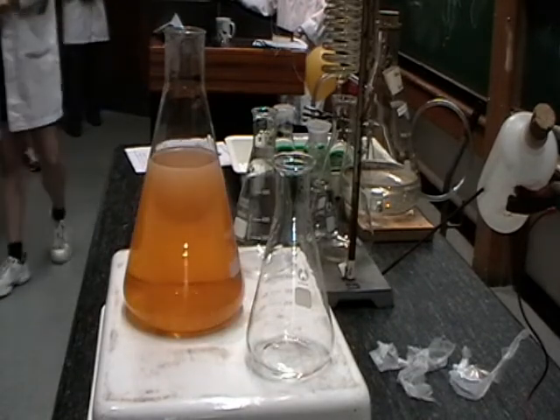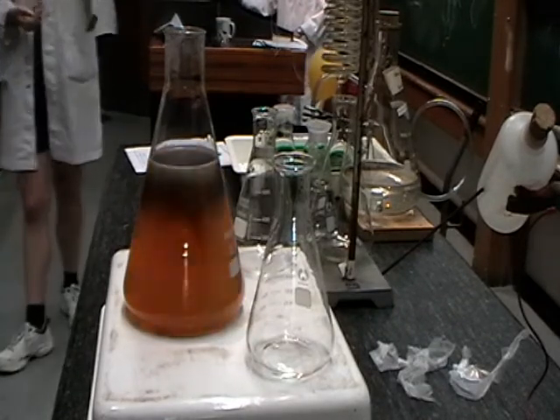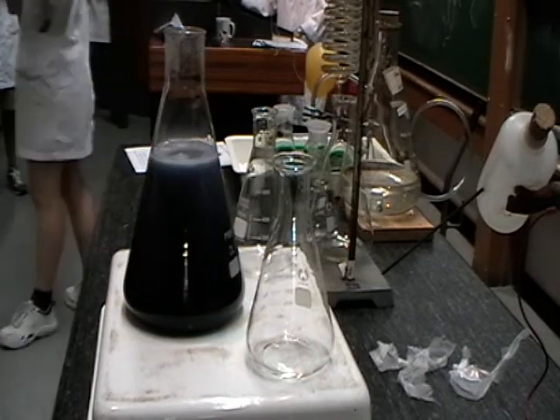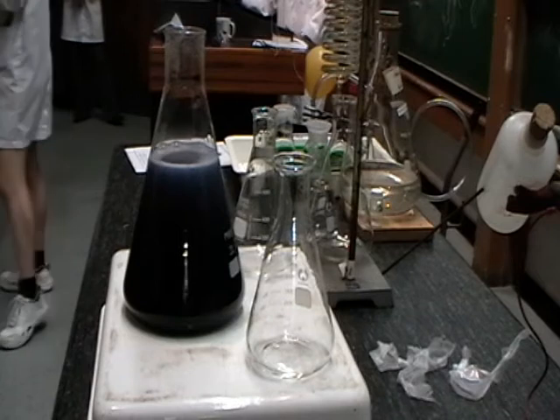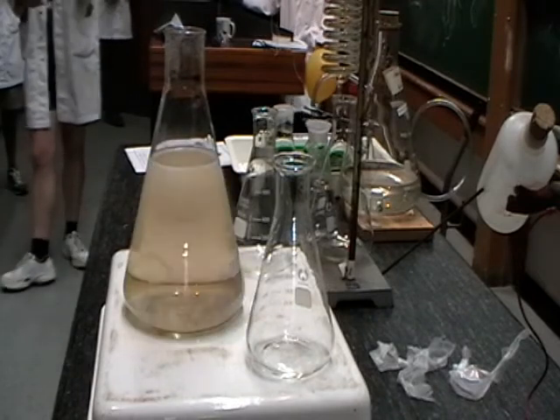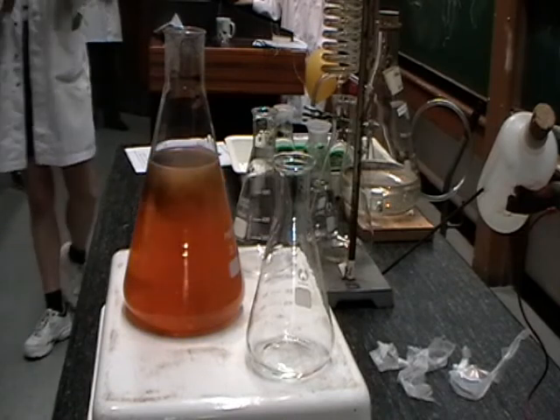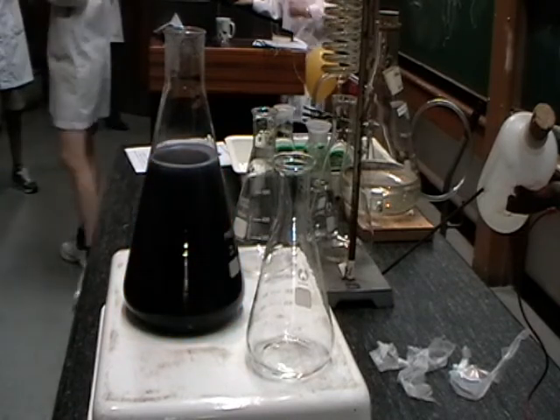As this continues — we're not going to sit and watch this forever — but if at some point during the rest of the demonstrations you look over here, you'll undoubtedly see that this has finally settled on a specific color.